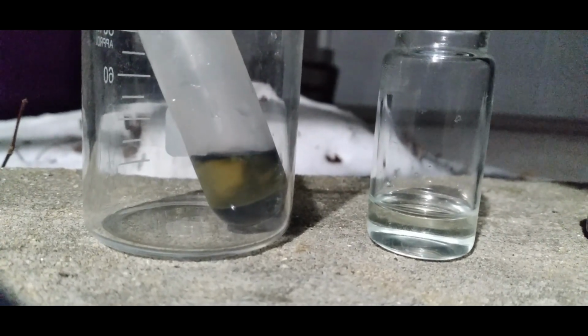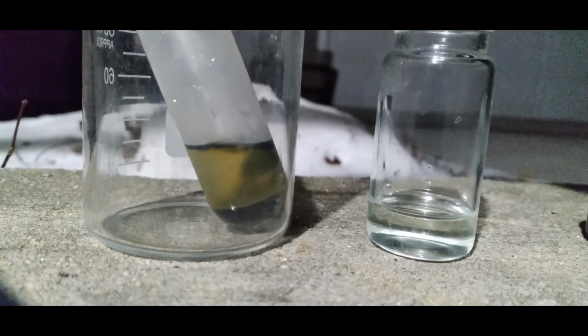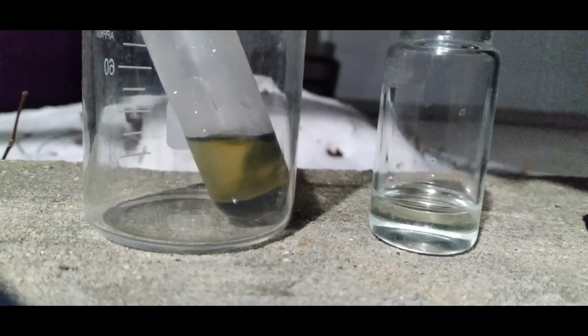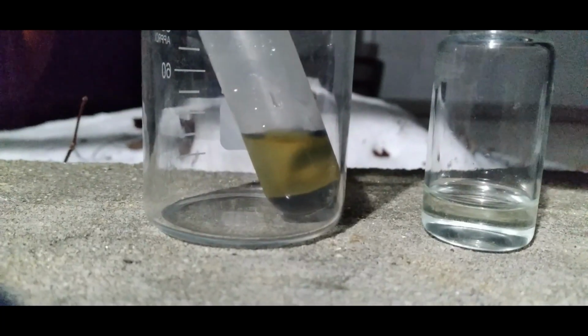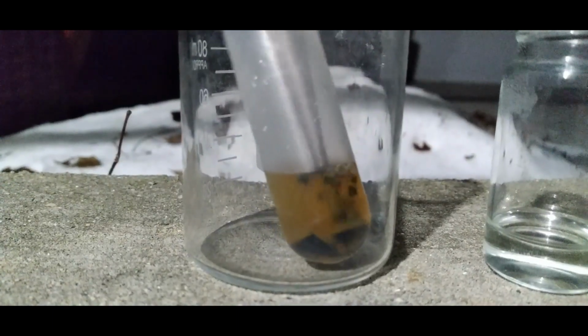In hindsight, I shouldn't have added so much of the solution to it because it ended up getting really dilute. Either that, or I simply suffered losses over the separation process. The osmium dioxide wasn't all dissolving, so I decided to shake the solution around. It turned out there was a protective barrier of magnesium hydroxide preventing the rest of the osmium dioxide from dissolving. So I just decided to break this up.